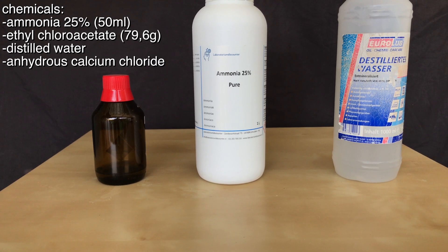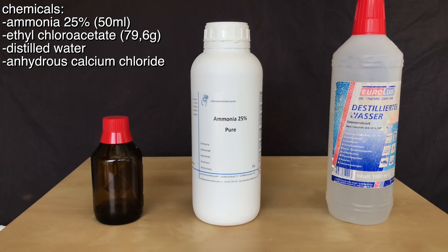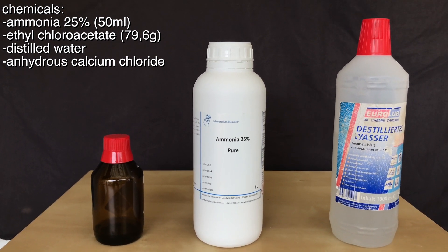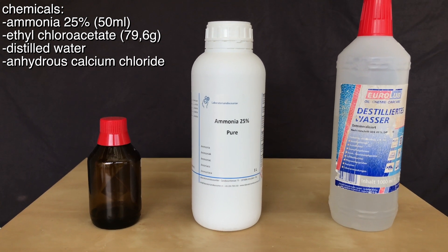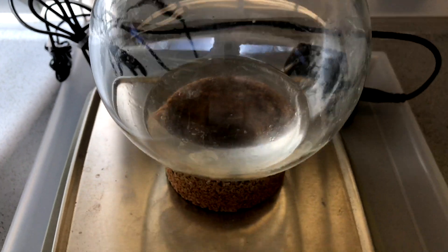Without further ado, let's begin with the actual preparation. We need 50ml of 25% ammonia solution, about 80g of ethylchloroacetate, distilled water, and anhydrous calcium chloride.